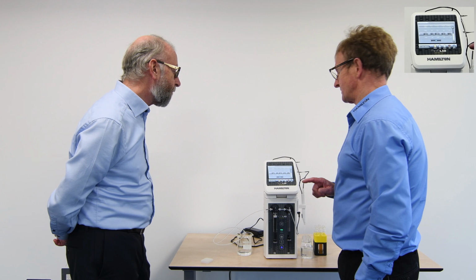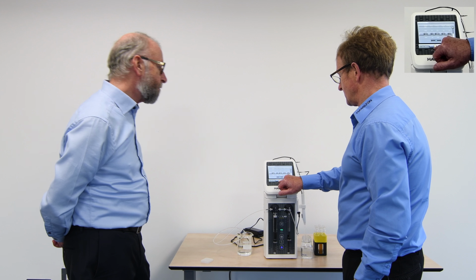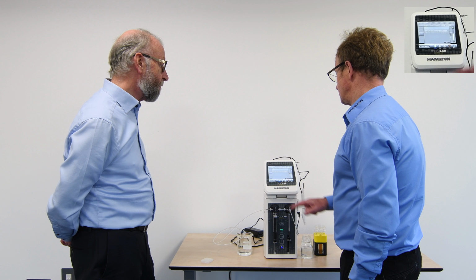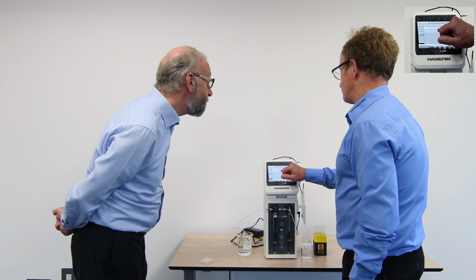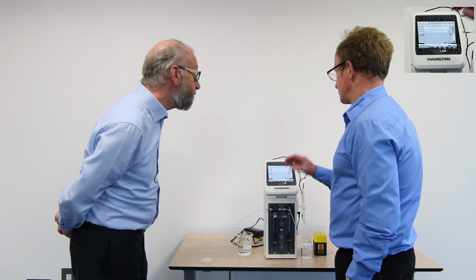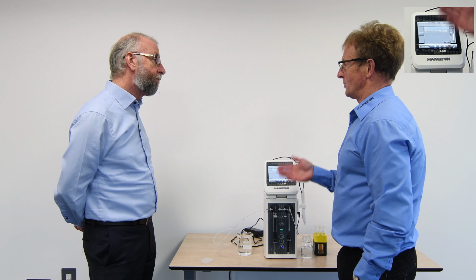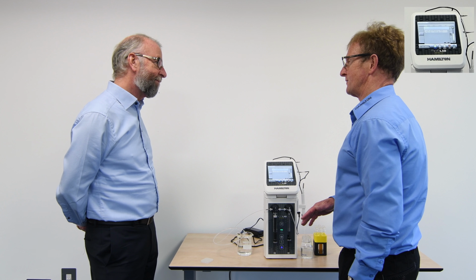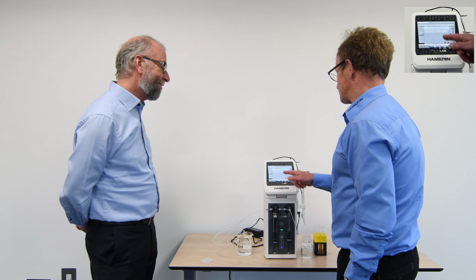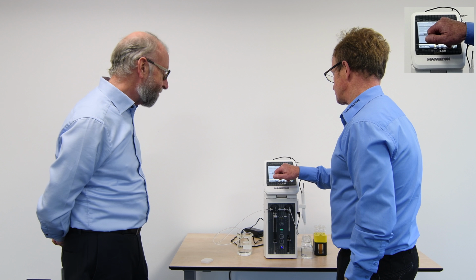Now, if I'd forgotten to actually change the other details, the good step in this is you'll notice this little icon here, it says validate. If I actually press validate here, you'll see this says the method will cause an overaspiration or dispense. So there is initially an error because we've asked it to aspirate more than we're dispensing, and therefore there's an imbalance. It's our spreadsheet of information there. So there's an error and it's told us where it is, which is the fact that I wasn't dispensing the correct amount.